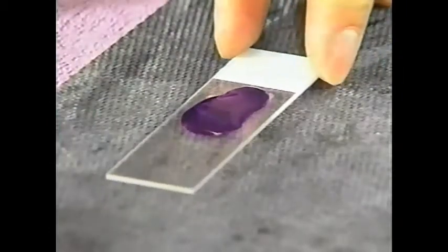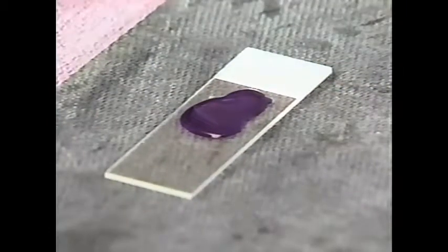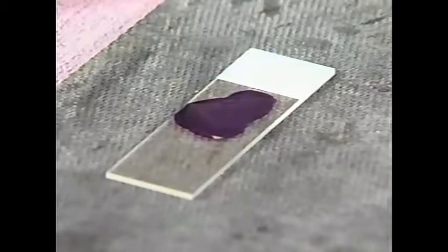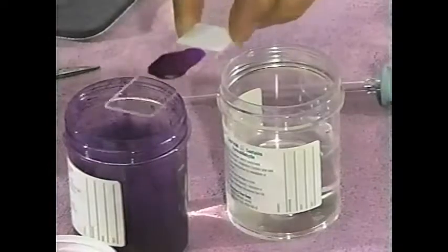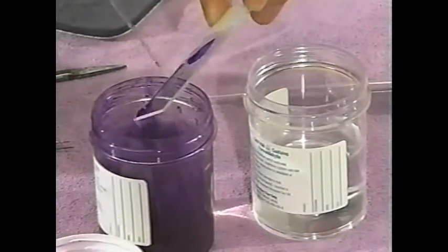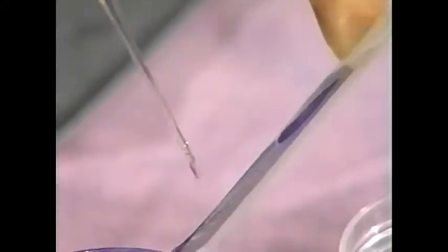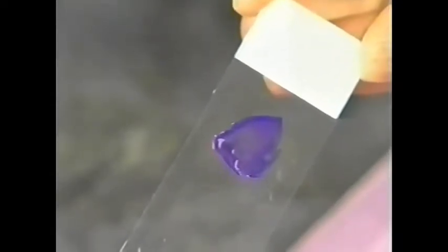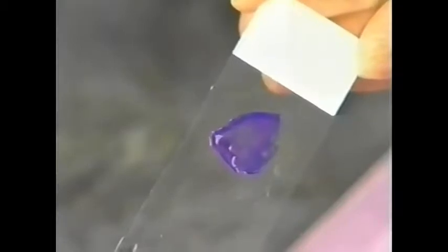Use a small bottle of Schiff's that's been refrigerated and kept in a dark bottle as it's supposed to be, and you'll get a quick stain. That's another area where people go wrong — they don't let it stain dark enough. We want it to stain dark. Once we drain off the fluid, we can use a pipette to drop sodium chloride solution or water onto the slide to rinse it. Let the fluid drain off and keep dropping clean solution until we get a clear prep. If we're seeing a lot of purple and dark around it, you probably didn't get enough of the yolk or albumin off, and it's going to be difficult to see.